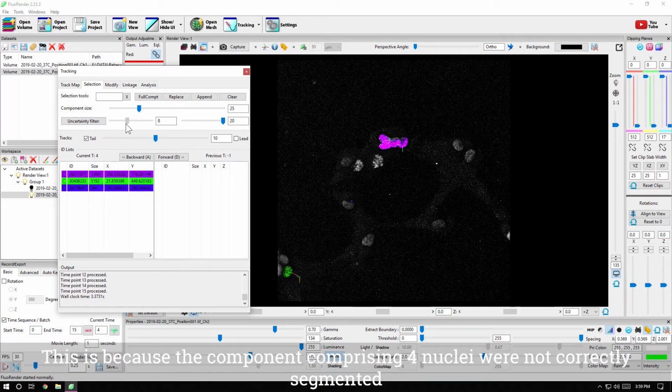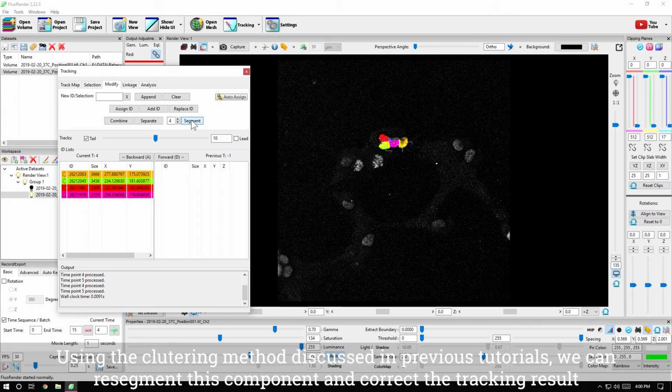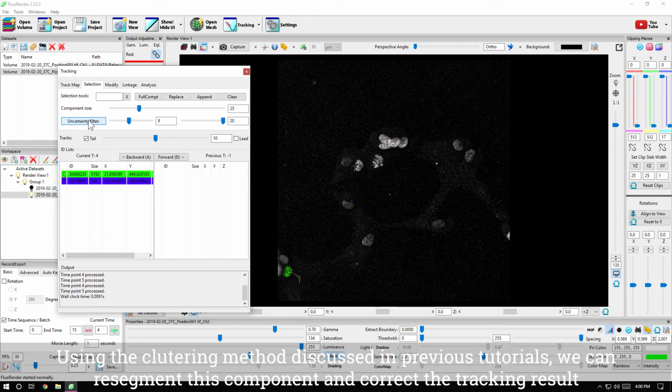This is because the component comprising 4 nuclei were not correctly segmented. The uncertainty filtering is very effective to reveal such tracking issues. Using the clustering method discussed in previous tutorials, we can re-segment this component and correct the tracking result.